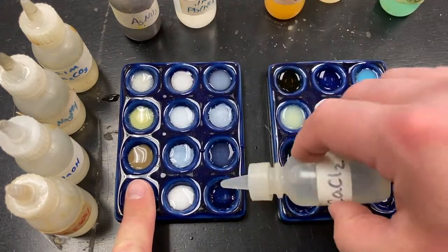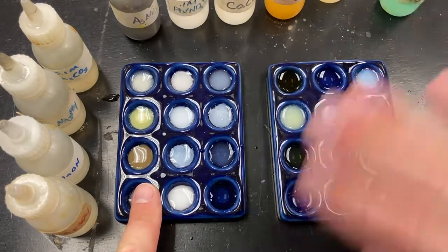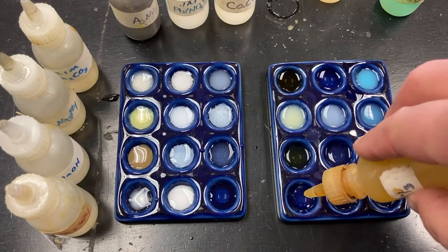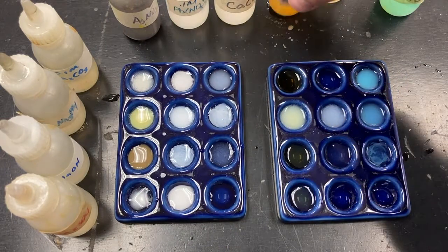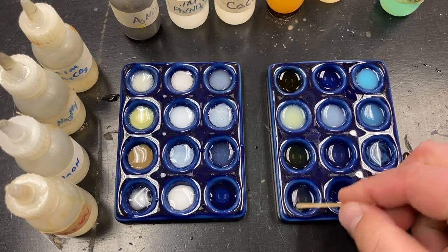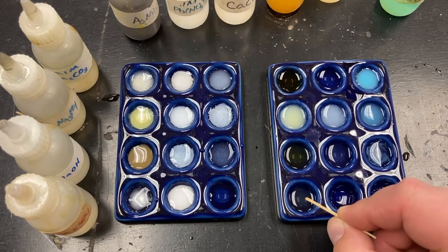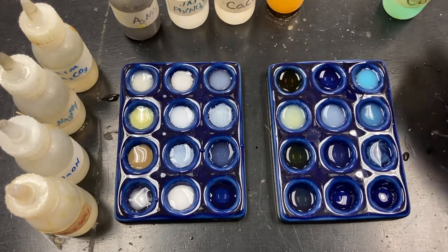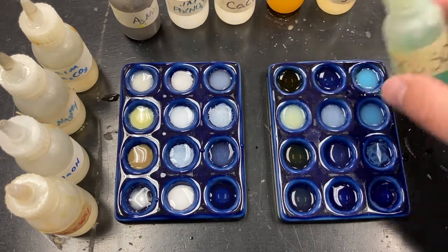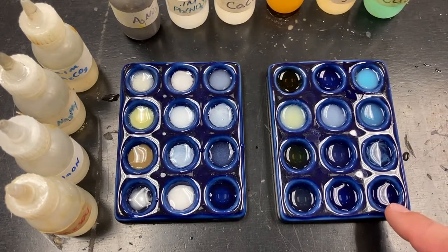Calcium chloride. Nothing. Nothing. Iron chloride. A very faint, hard to see the color in the blue background, so we'll have to come back to that one a little later, but there's a very faint solid in there. And then magnesium sulfate. I don't see anything there. And then copper sulfate. I don't see anything there.